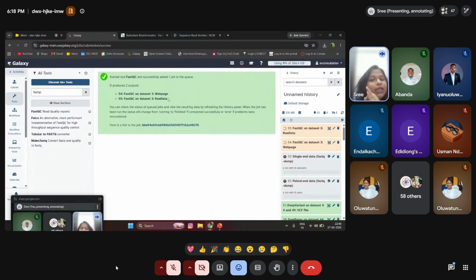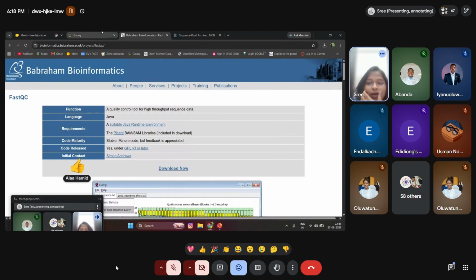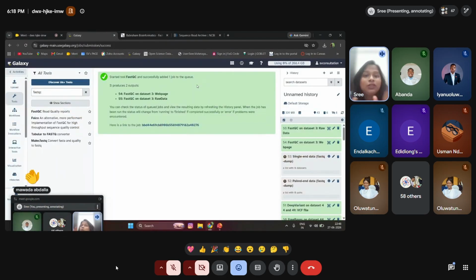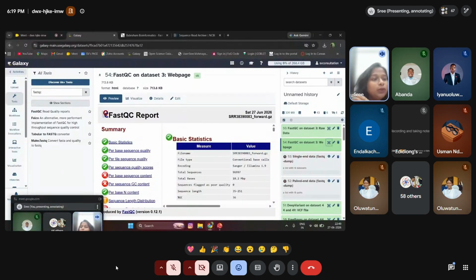Another one is giving the raw data output. Two pieces of information it will provide. So far, you guys can get an idea, right? Or is it very difficult to understand how it looks? Once the quality check process is over, you can see the history. You have two pieces of information: one is the raw data, another one is the web information. The first thing we're going to see is the web information. So this is how the FastQC report looks like.